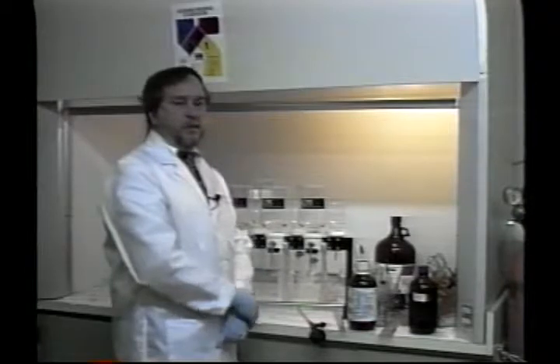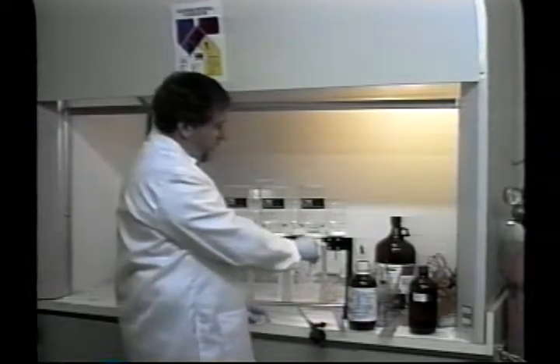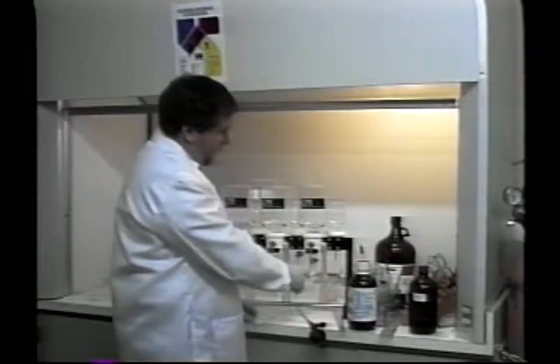In order to elute the analytes off the disc, you use the same solvent or a combination of solvents that you use in the wash step. Essentially what you do is add the solvents to the reservoir. It just then goes through the disc and elutes off the analytes that you're looking for into the collection vessel.